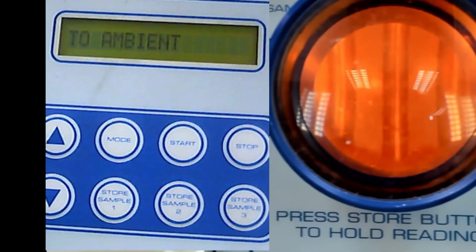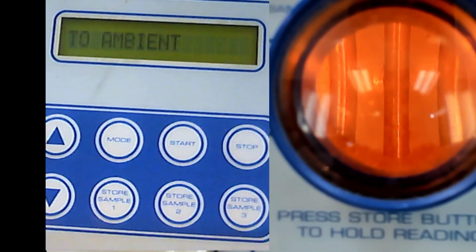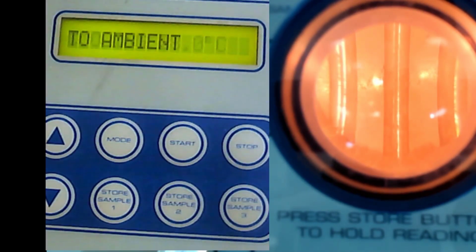I just need to make sure the focus is okay now. I need to close the lamp first because there is reflection there. Is it okay? Oh, not yet. Not okay yet. Same. Doesn't matter. I think it's okay.